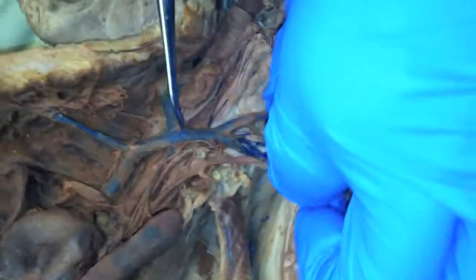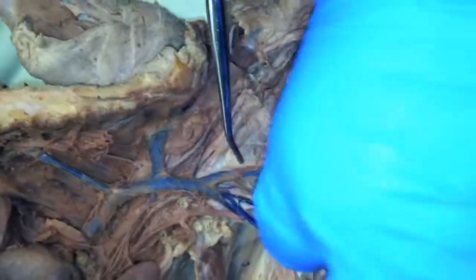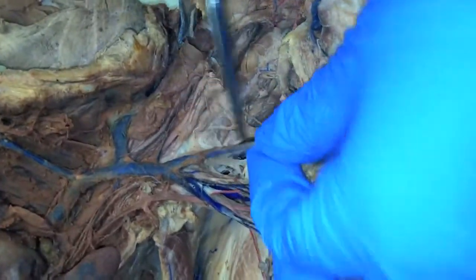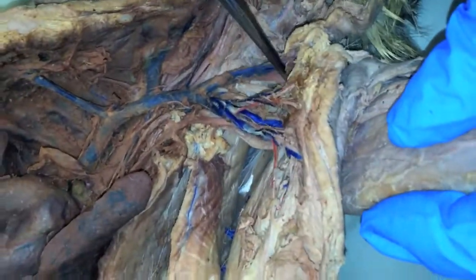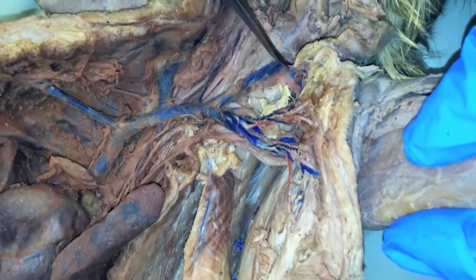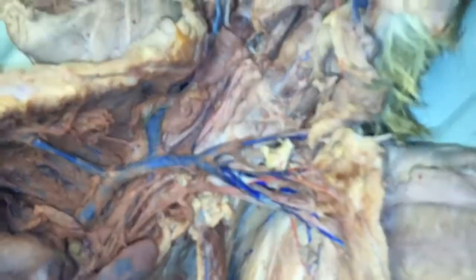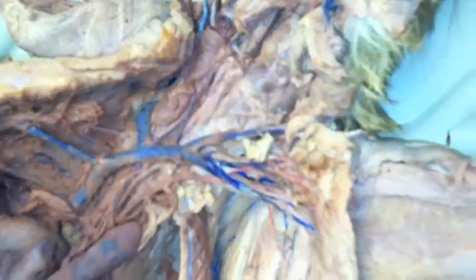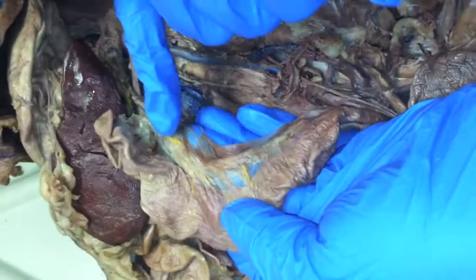You can always tell your thyrocervical because if you follow it up, it'll produce the transverse scapular here. The one's heading back that way with the vein — you see the pink one there? That's coming off your thyrocervical. See, there's some yellow in there.